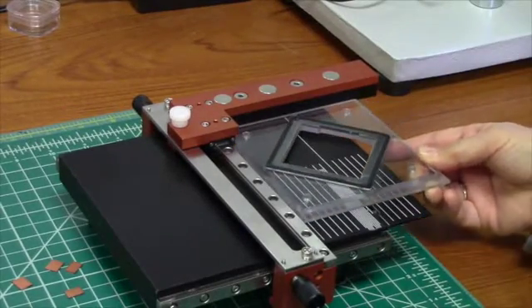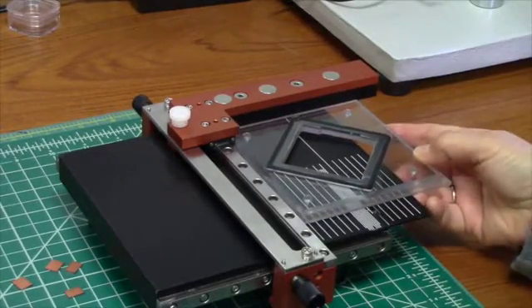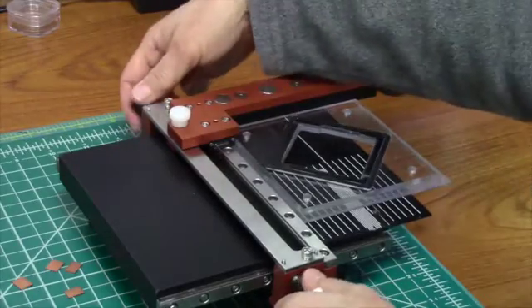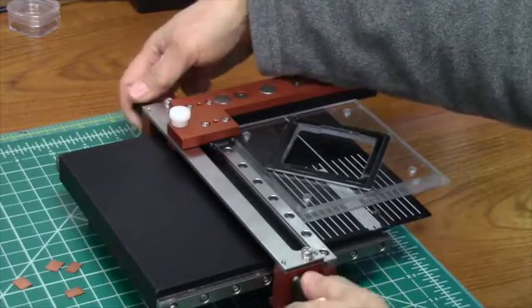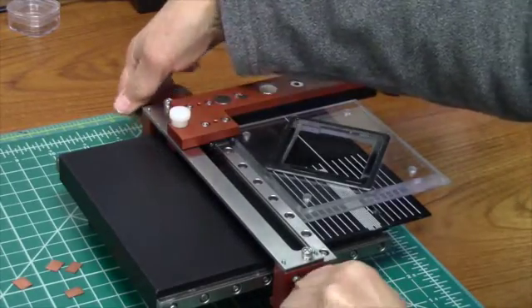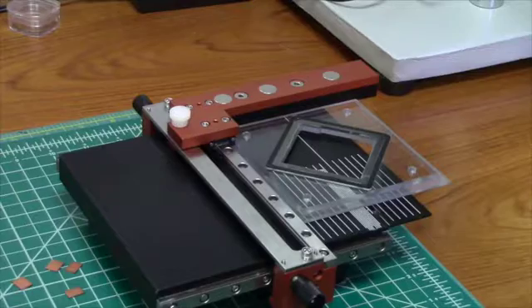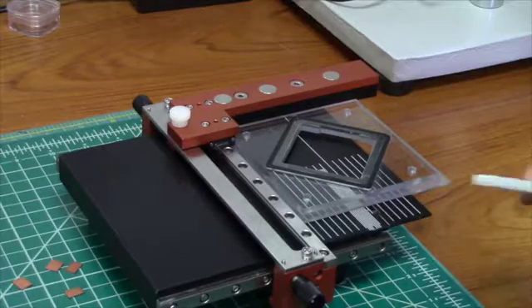Place the holder on the flip scribe, but make sure the rails are locked in position.